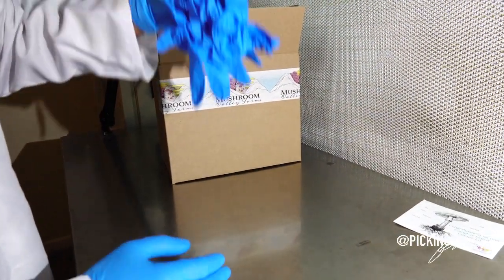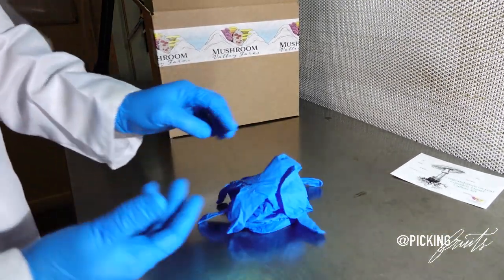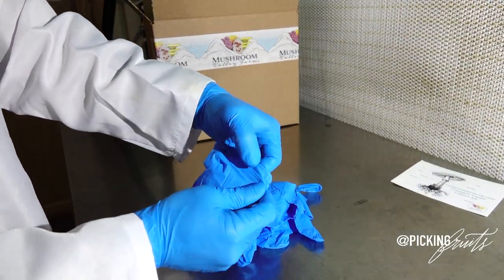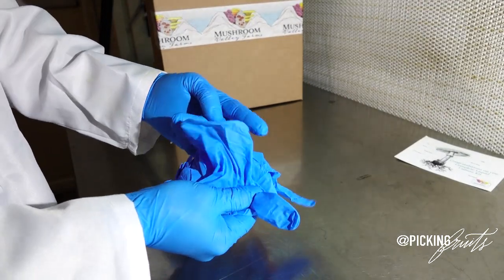The next thing that you will find inside of the box will be three pairs of nitrile gloves, same gloves that I am wearing. These gloves are nice because they are extremely durable, they are somewhat reusable, and they are good for people with latex allergies.